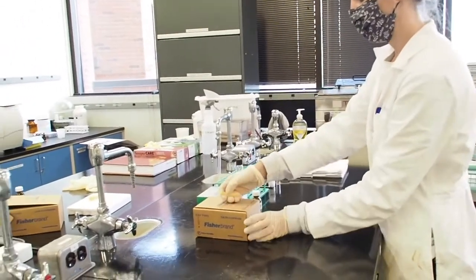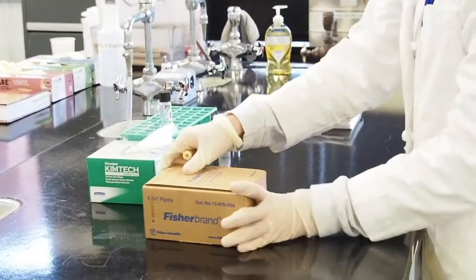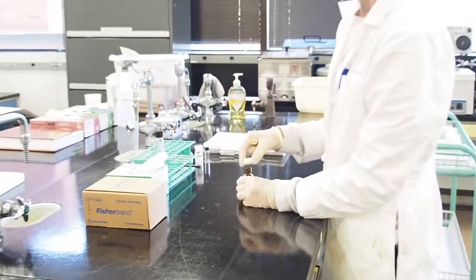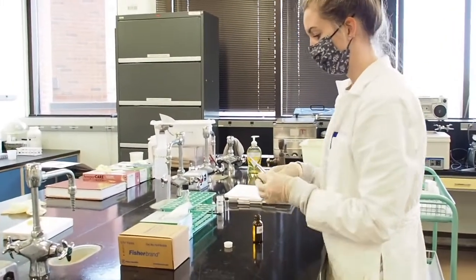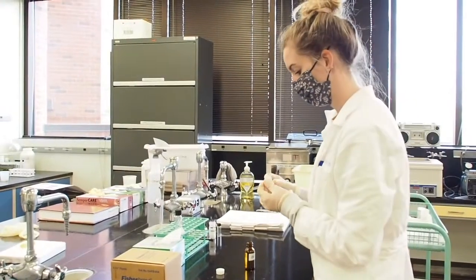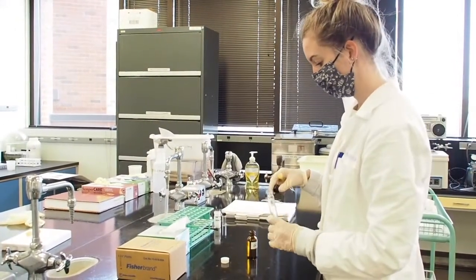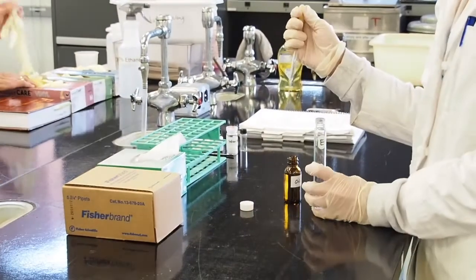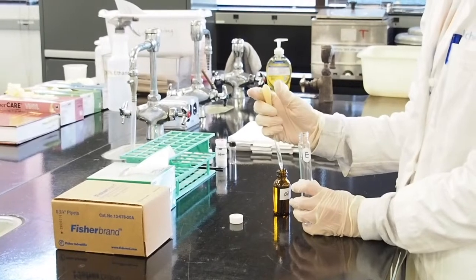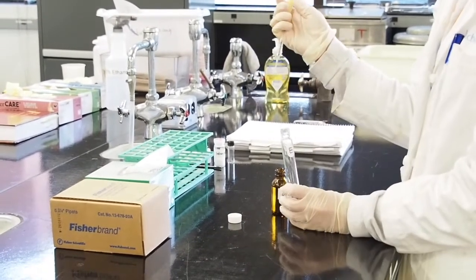So now we will put 2 drops of oil into our tube, and we call this semi-quantitative data. The reason that we call it semi-quantitative data is because we are not adding a known volume or measuring our volume of the oil that we are putting into our tube for the analysis. We could help to make this more quantitative by weighing the oil that we are putting in, but for the sake of identifying the oils, we are going to use a semi-quantitative approach.